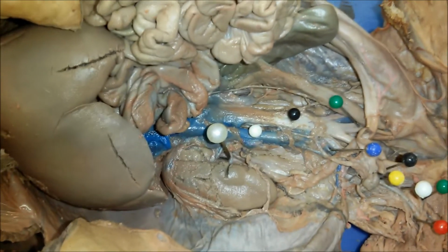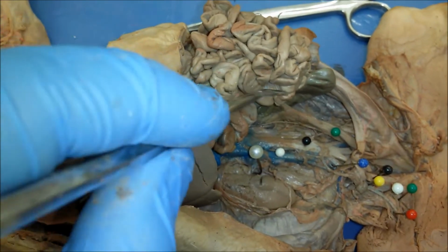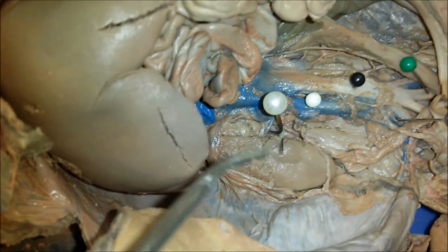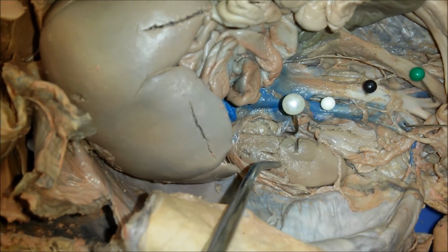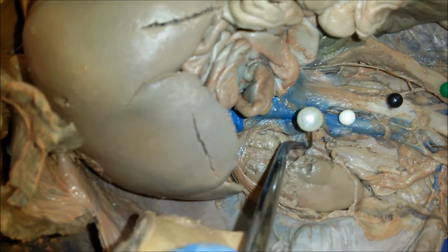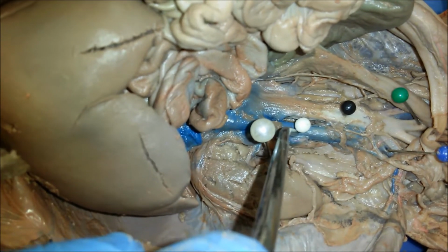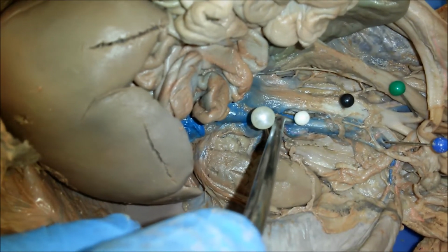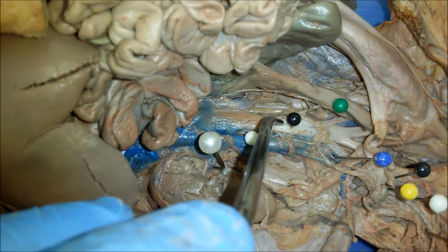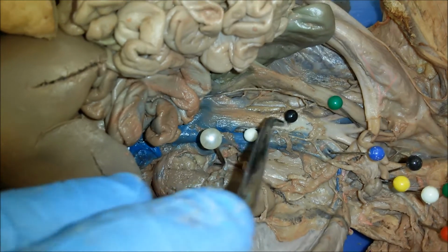Now in the abdominal cavity, as you can see, I moved away or reflected the intestines and the urinary bladder here. And so now we can see this right kidney, and going in and out of the kidney, there's renal artery and renal vein. And then here we have the inferior vena cava. So this is the abdominal portion of the inferior vena cava. And then next to it, or parallel to it, there is the descending or abdominal aorta.